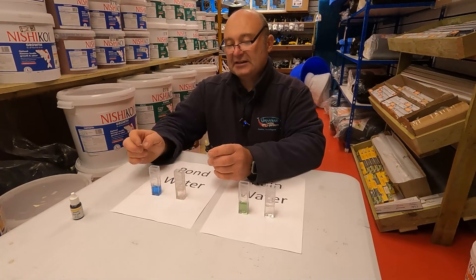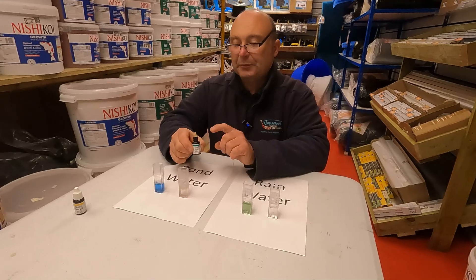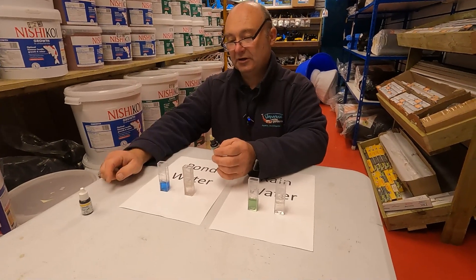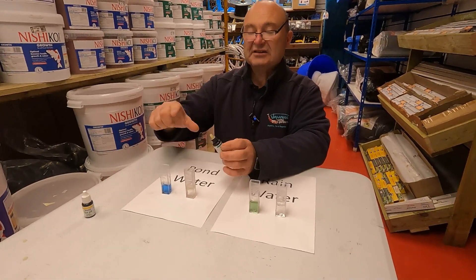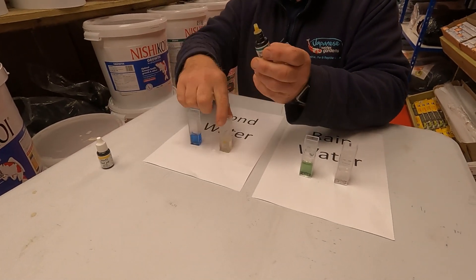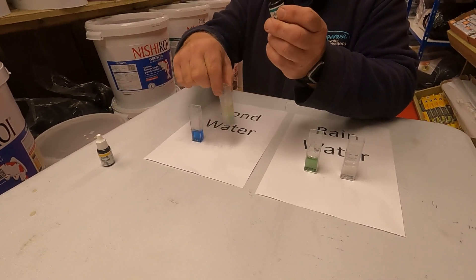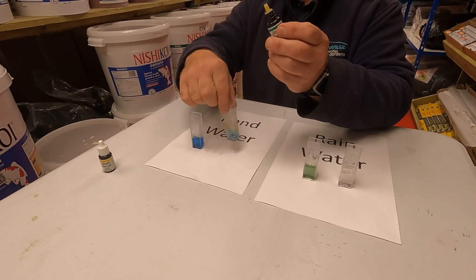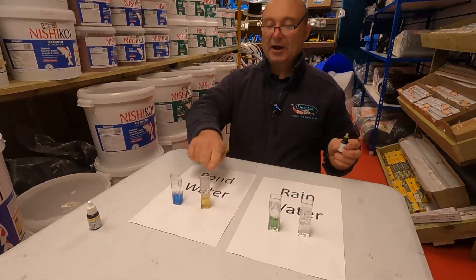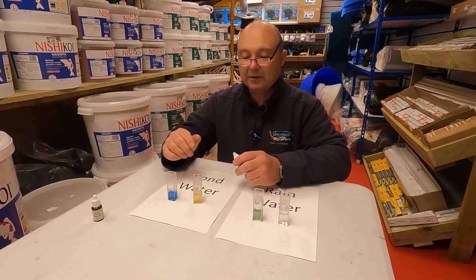KH is a test of carbonate hardness. The more drops we have to put in before it turns yellow, the higher our carbonate hardness — and higher carbonate hardness is considered more stable. So let's count them into the pond water. 1, 2, 3, 4. It took about 4 drops to turn the pond water yellow, which means we have a carbonate hardness of about 4.